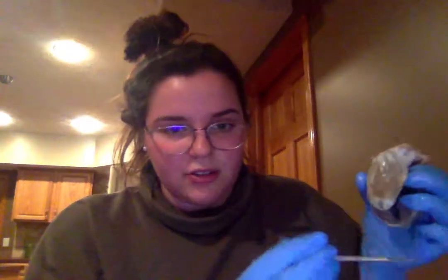And then the interventricular septum is, if I open this right here, you can see this big piece of muscle right here. That's the interventricular septum. And then next we have the endocardium. The endocardium is the internal lining. So it's this innermost lining right there.